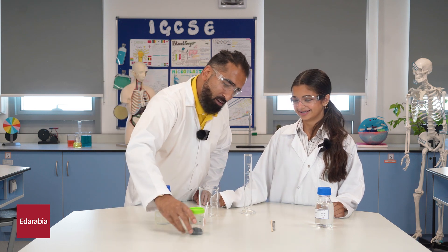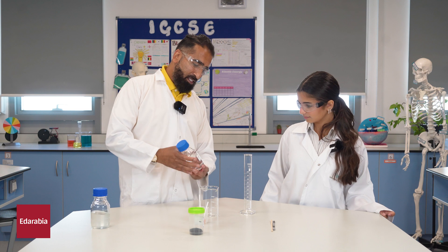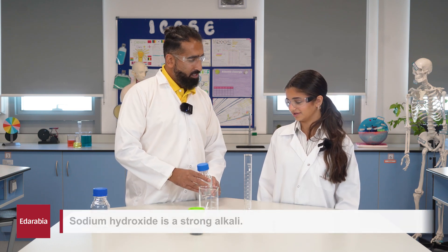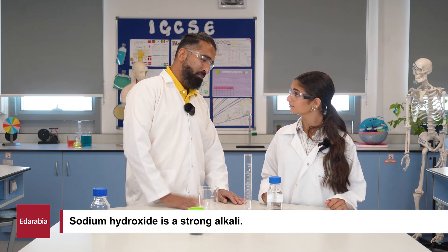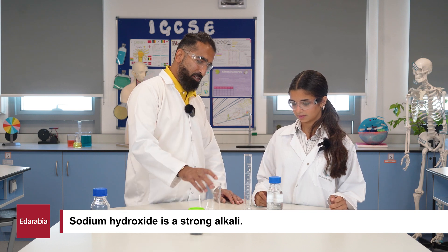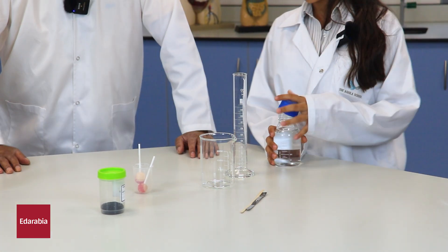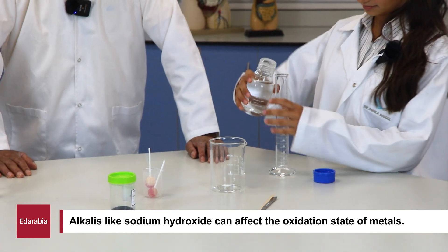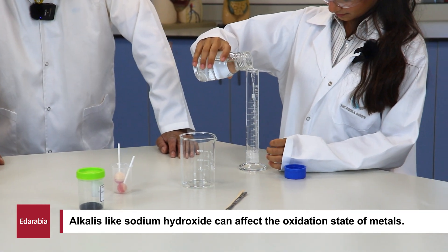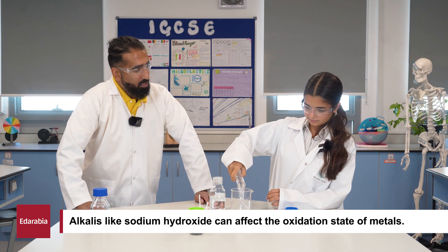So let's see what colour the manganese ion actually is. What substance have we got here? Sodium hydroxide. So what we need, Maria, is 200 mils of our sodium hydroxide into this beaker please. Sodium hydroxide is the alkali that we're going to use in this reaction.